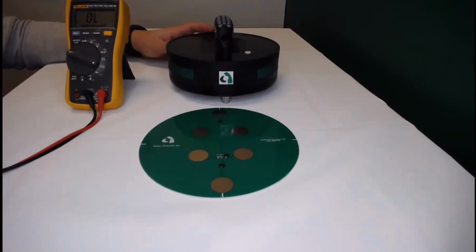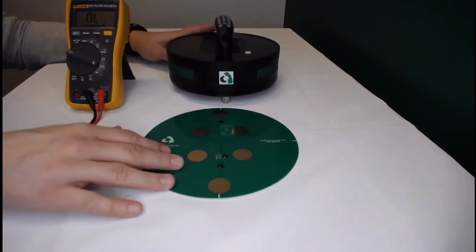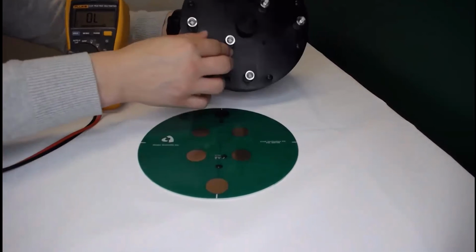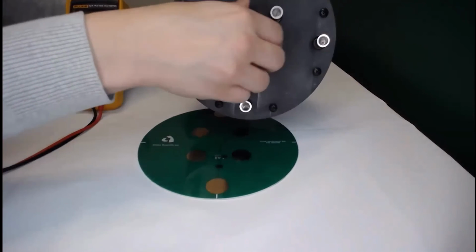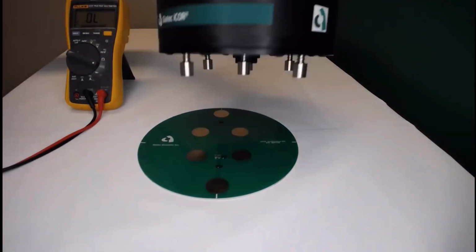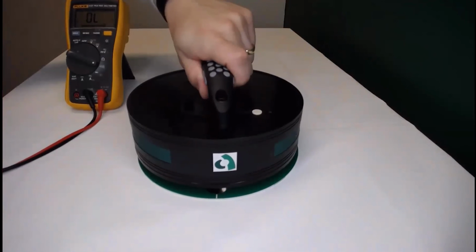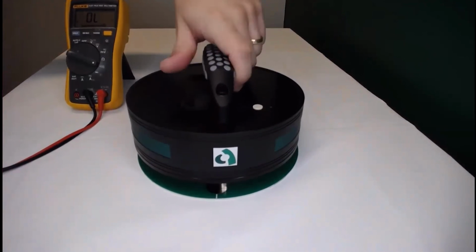specification. If by cleaning the electrodes and also the metal faceplate, you still don't have continuity, another option is to remove the cap from the half cell electrode on your iCOR device. By removing the cap here, we have more leeway over here. So you can further press down the device onto the verification disk to enable a better continuity.